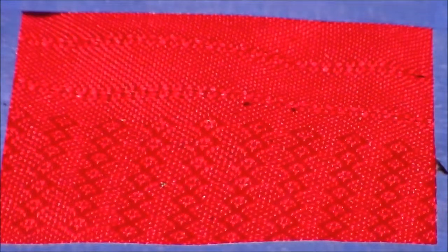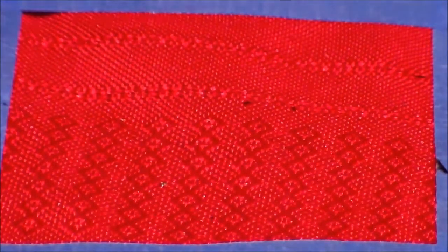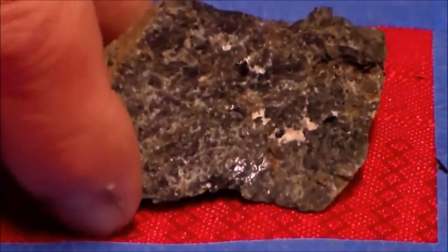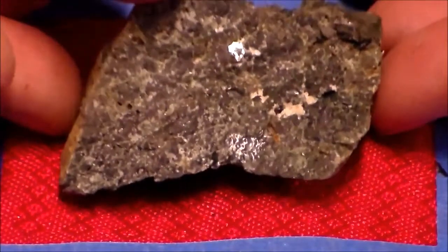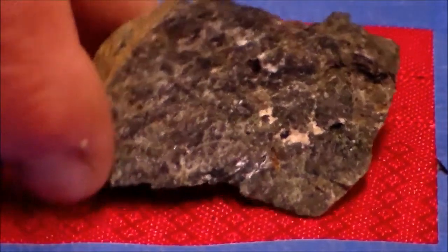Now let's start with our 5 dark samples. Looking at number 4 on your mineral data collection table, it says it has granular crystals. That one doesn't appear really granular. When you think of granular, you need to think of grains of sand on a beach. Those are grains. This doesn't have grains in it. It has crystals, but they don't look very granular. So we're going to say that's not it.